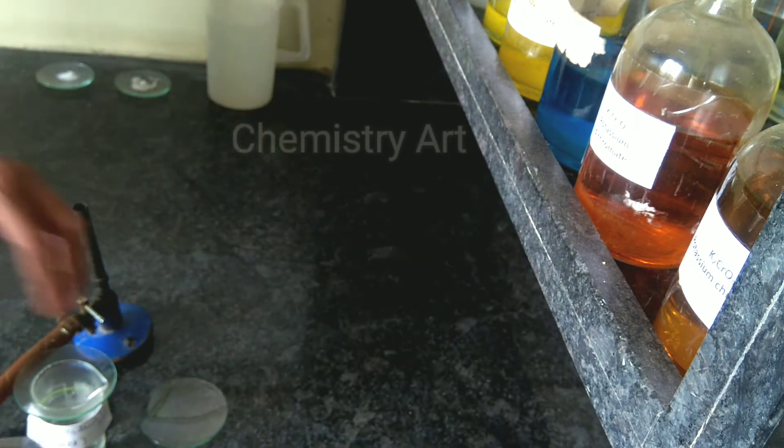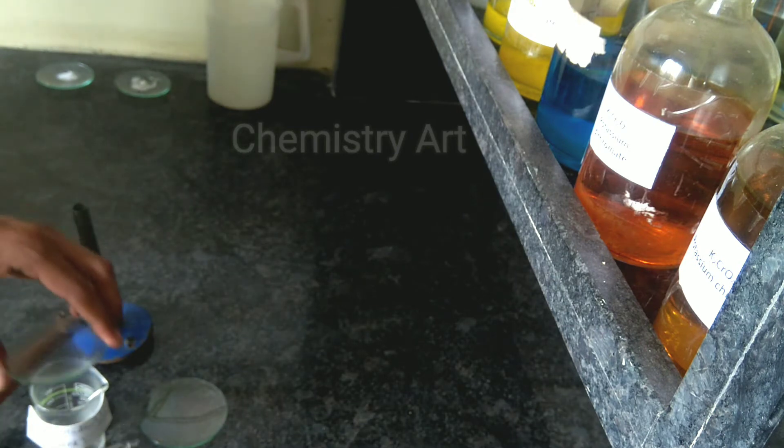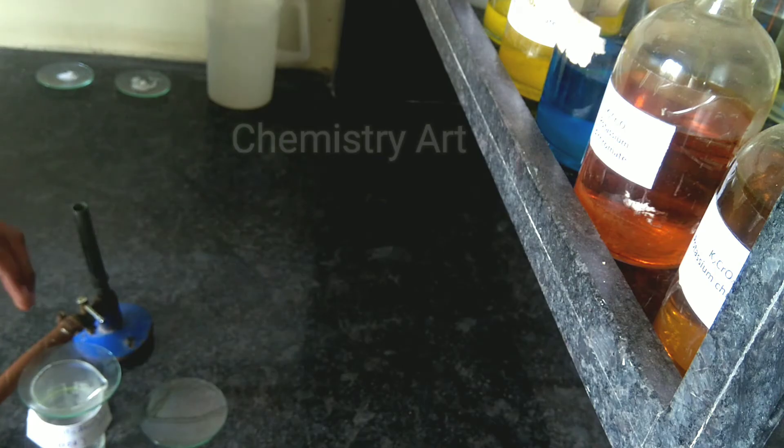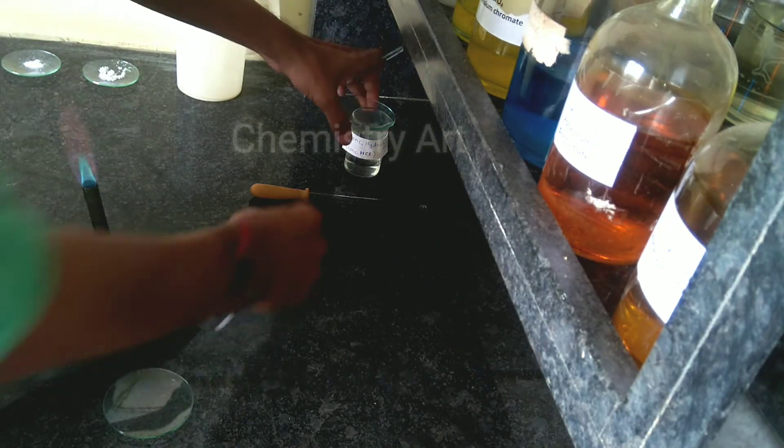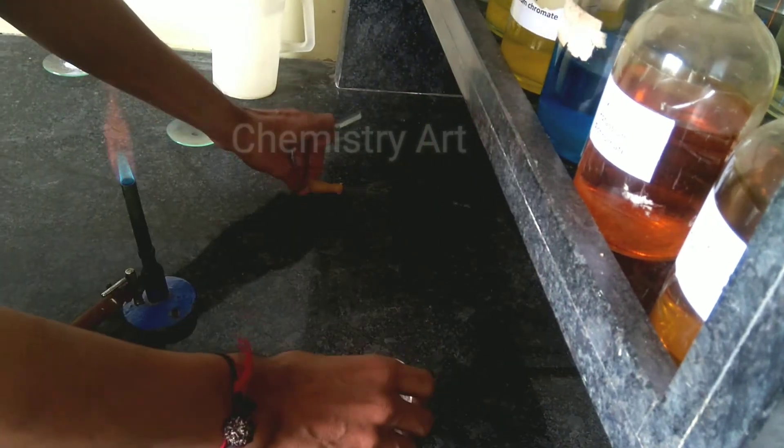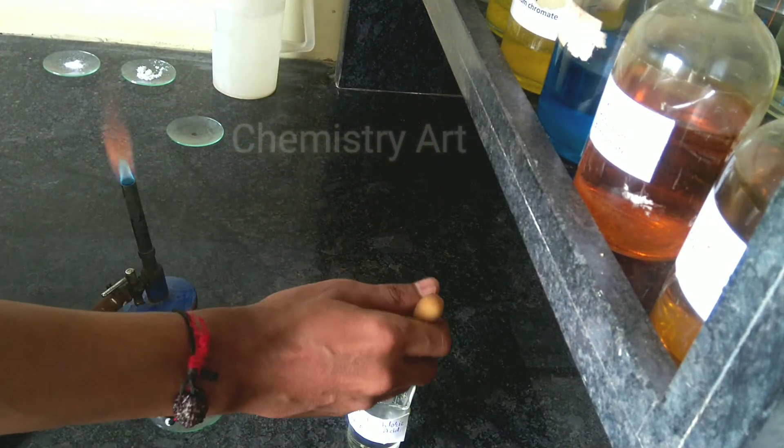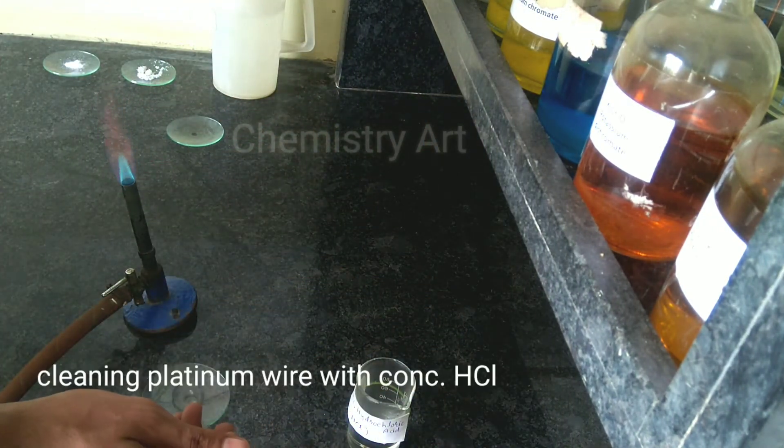Now I am taking salt and I will add concentrated acid to make a paste of my salt. I have lit the burner and now we will check out which positive ion is there.